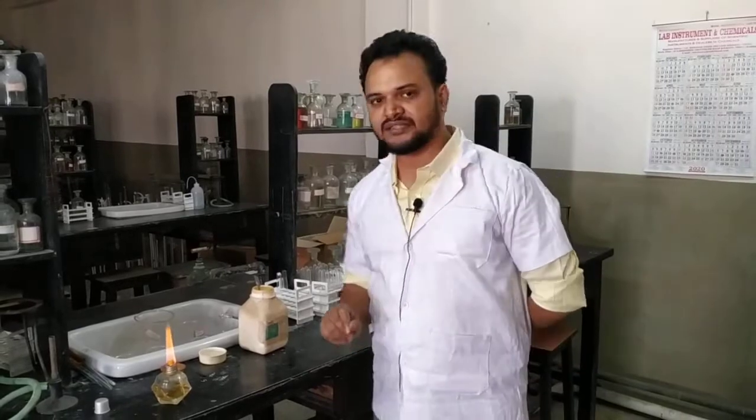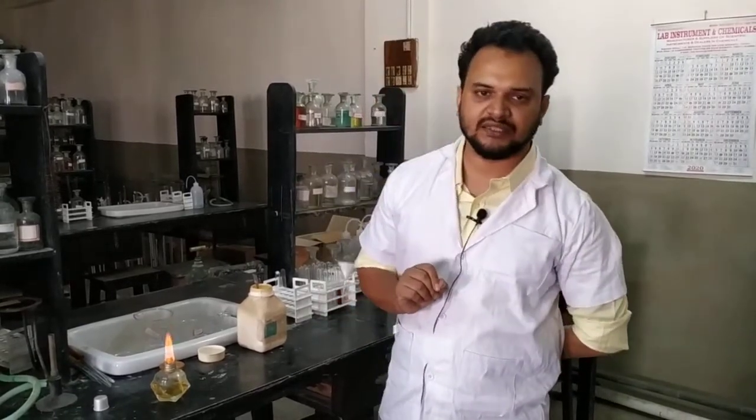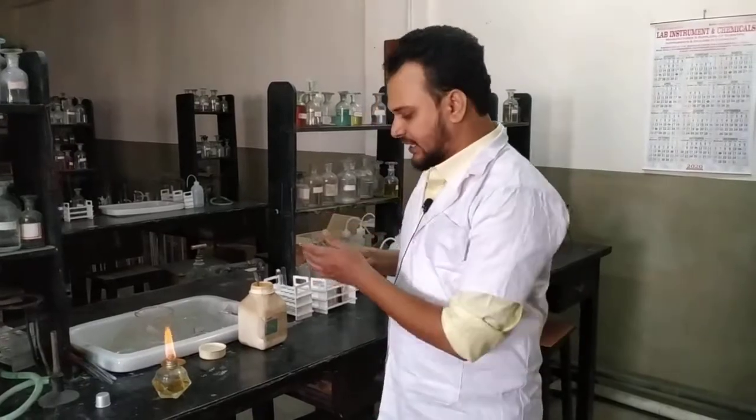Now, the third and final test is the reaction of neutral FeCl3 with benzoic acid solution. So let us see what happens.